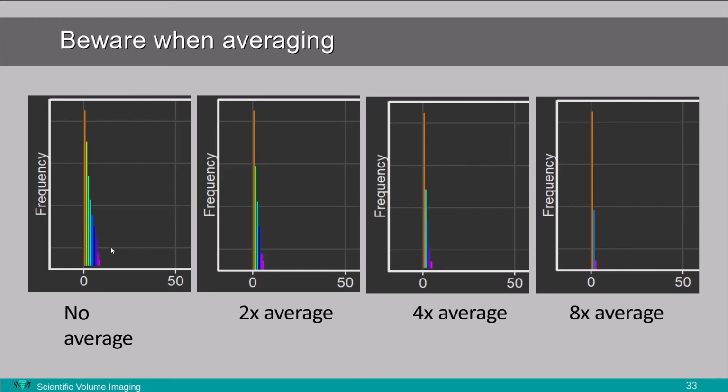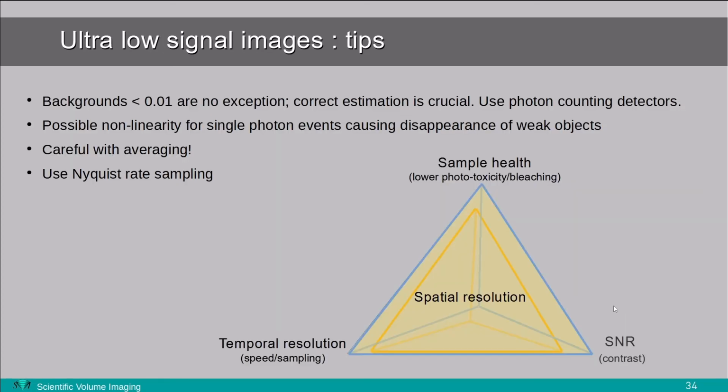And this is also nicely reflected in this histogram. If you apply no averaging, you still see that you have a lot of signal, or reasonable signal here, but you lose this signal if you average more. So it's not a good idea to average at low signal. So some suggestions then. If the background is really low, the correct estimation is crucial, and use photon counting detectors or use accumulation settings. You have non-linearity of single photon events, and that can cause a disappearance of weak objects. So be very careful then with the averaging.